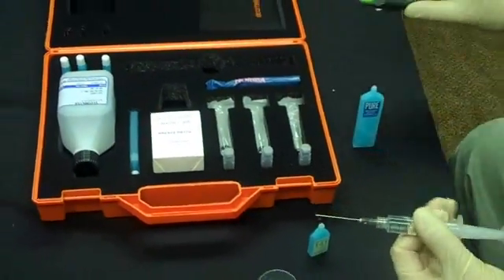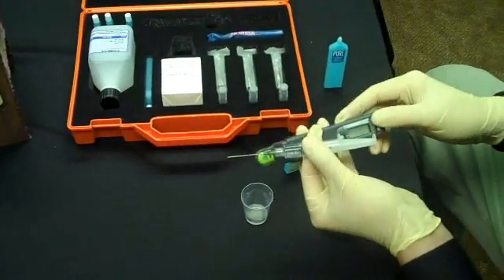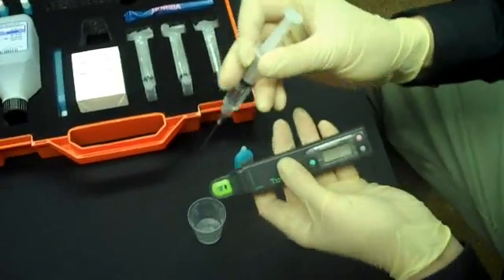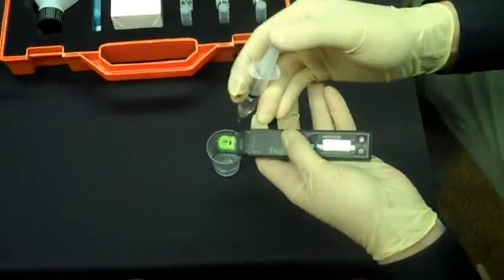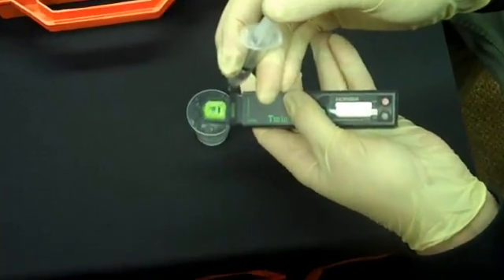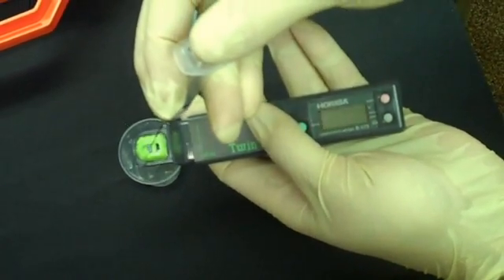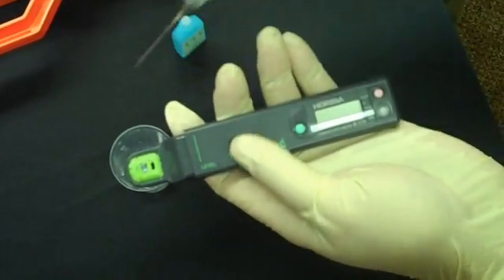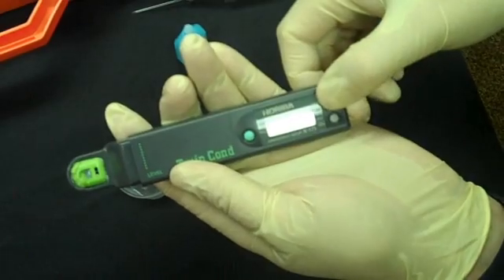We need the conductivity meter now. It's always good to rinse the meter with the solution that you're going to be testing. We'll just run some of this test solution over the sensor, and now we only have our test solution in that area.